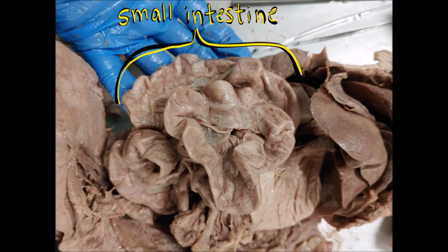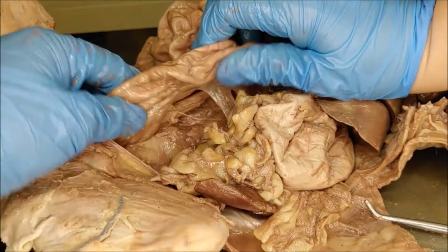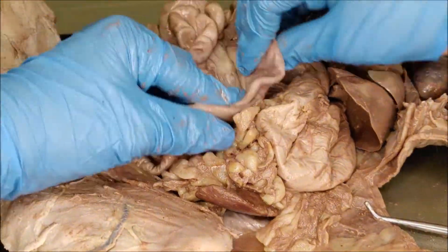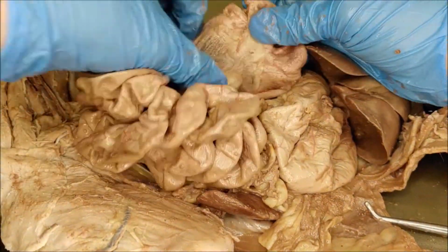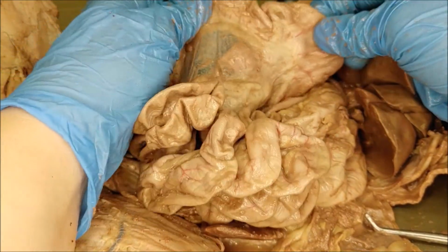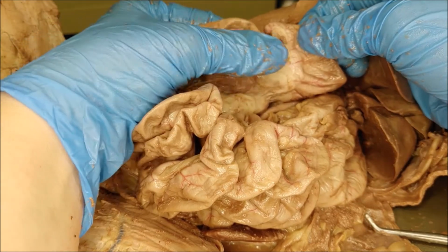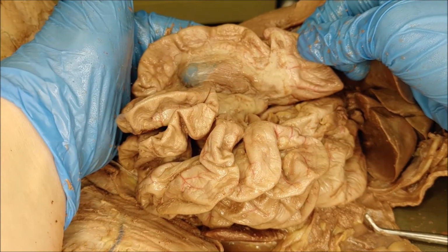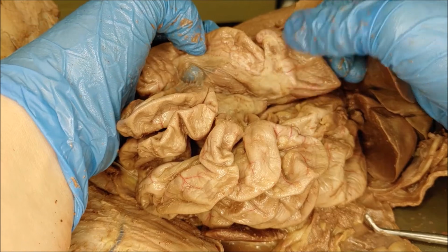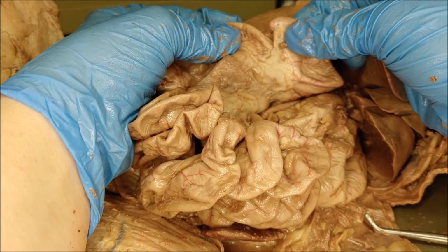And then the small intestine is held in these loops with this thin sheet of mesentery. And then the large intestine is a larger diameter. The very end of the small intestine right here is called the ileum. And then the very beginning of the large intestine is called the cecum. And then the ileocecal valve is in between. So ileum, cecum, and the ileocecal valve.